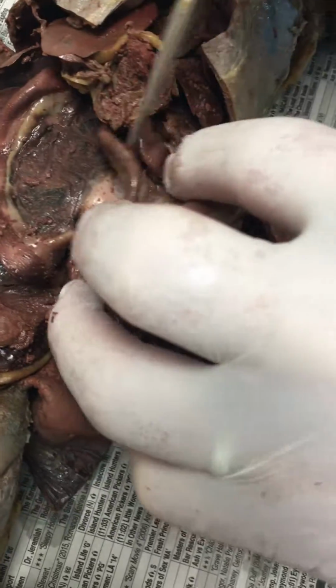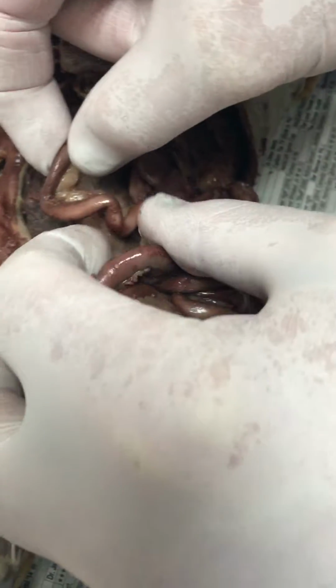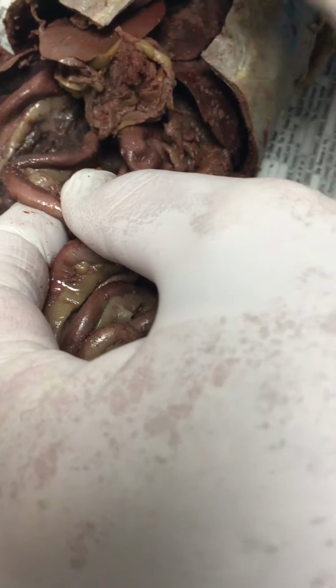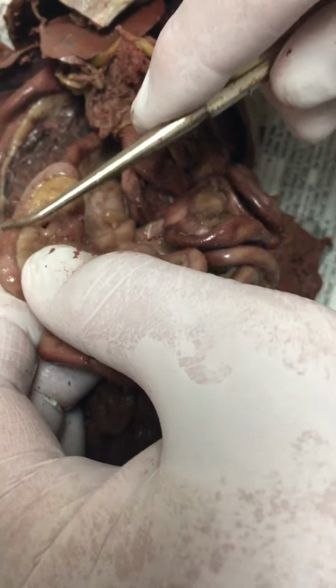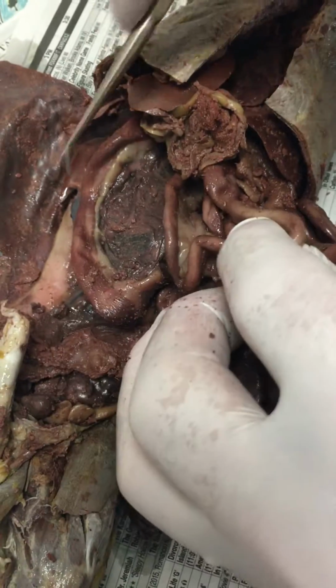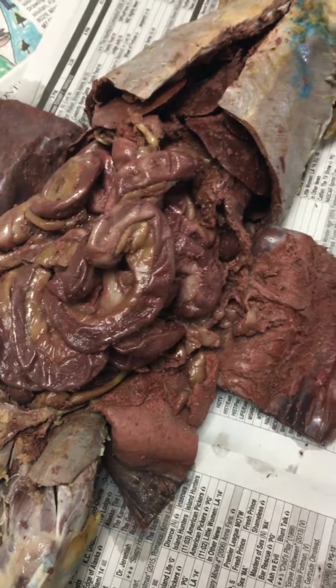Let the next flap fall. That's the ascending colon. Now, right where you get the loop at the bottom, where the ascending colon ends, that's your appendix. The part of the small intestine next to that is the ileum. That's the bottom end of the small intestine, and that's the top end. The middle of the small intestine, let it drop and sit. Any place in here, we're going to call jejunum. So it's duodenum, jejunum, and ileum on the end.